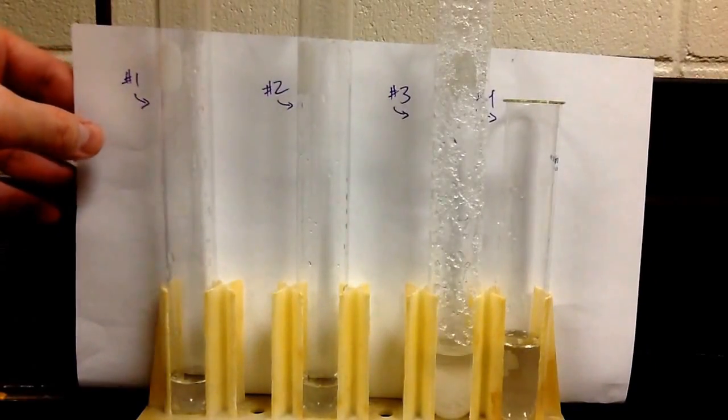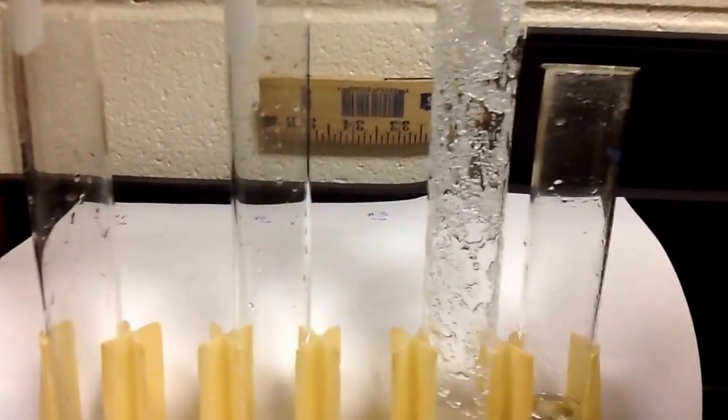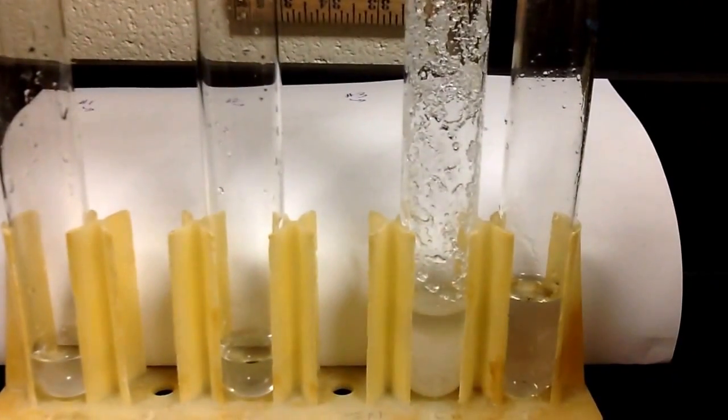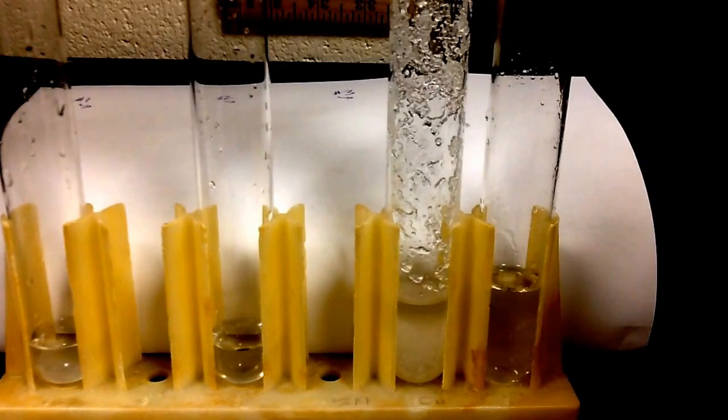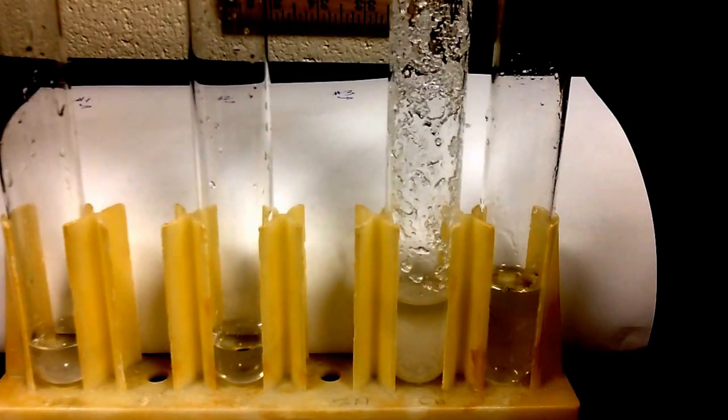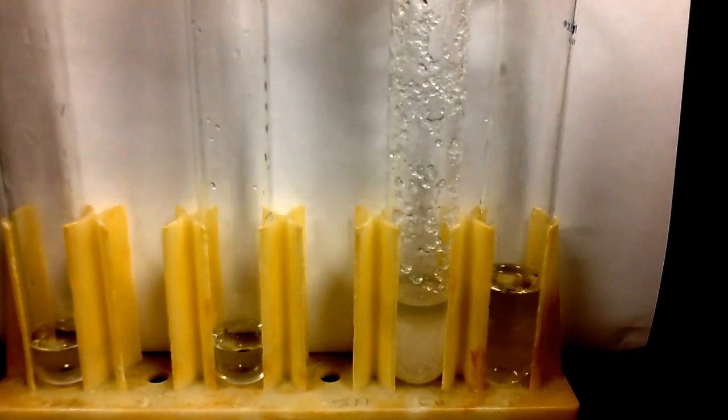So now we're in test tube number four. Let me see if I can zoom in on it and get a little picture of what's going to happen here. So what we've done is that all the solid that's in that test tube number three, we've got all that dissolved in there.